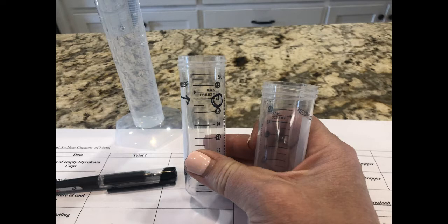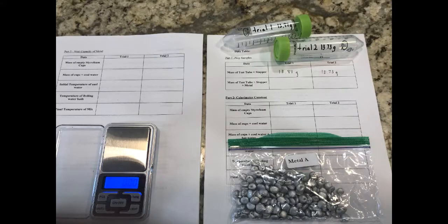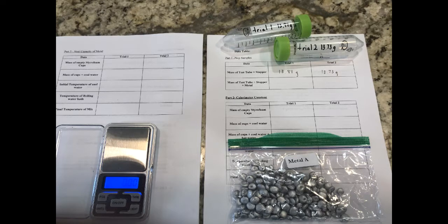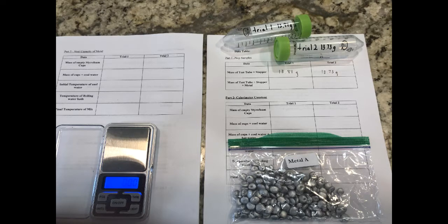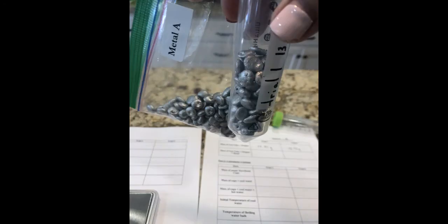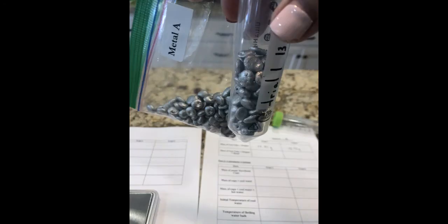Step 2. You'll need to know the mass of the test tube plus lid for each of two containers. I recommend that you rest them on their lid on the balance and that you label them Trial 1 and Trial 2.